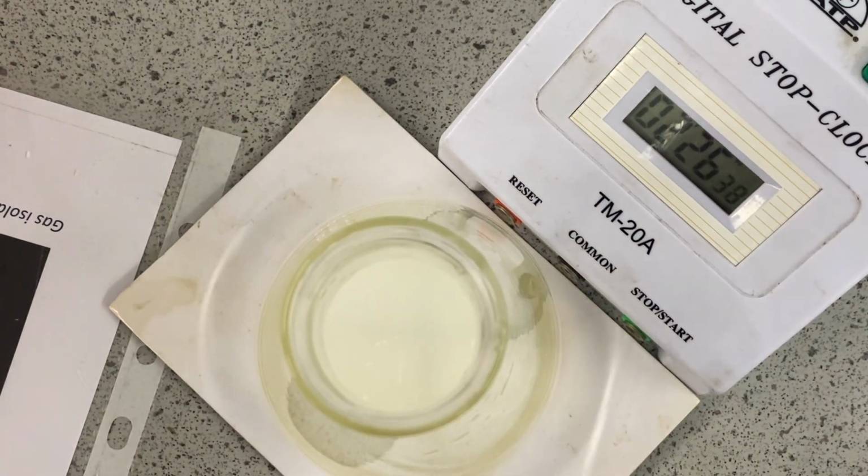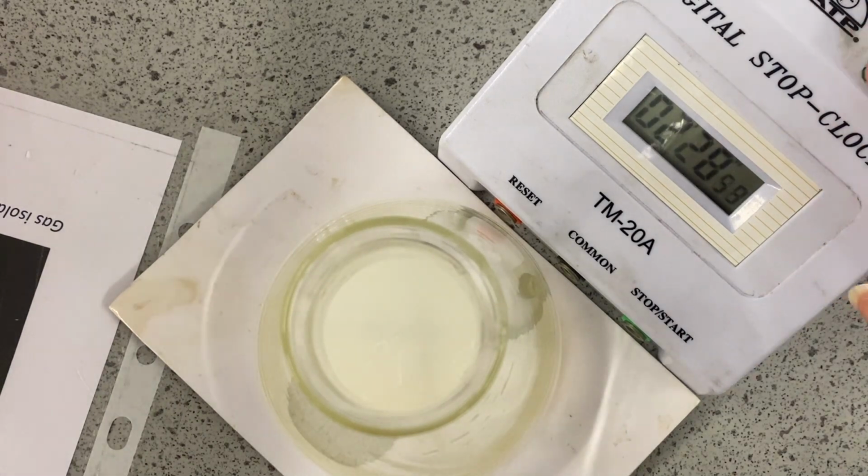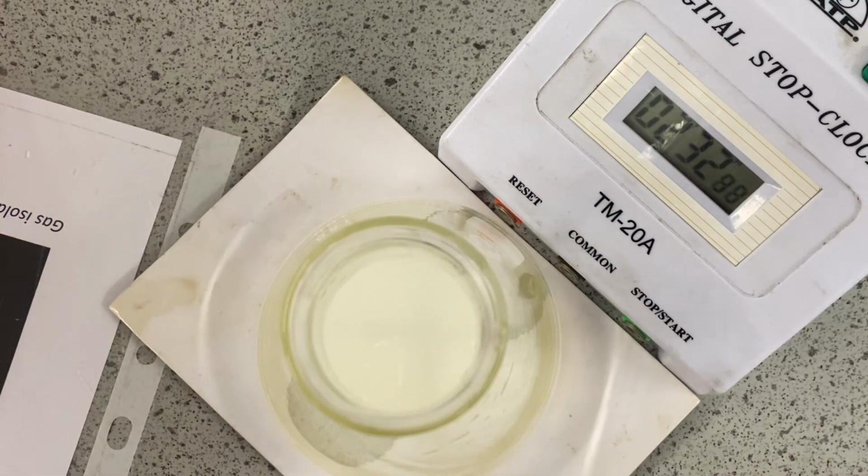That might depend on the individual, but it also can change from one person doing it every time being a little bit less clear one time than the next time. Okay, I'm going to say that that has disappeared now. Okay, so we're at 2 minutes and 42 seconds. So that took quite a long time.